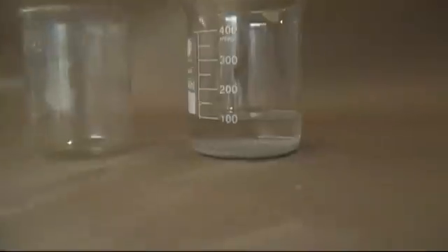Terbium sulfate is not very soluble in water, so after the 4 grams dissolved, I was left with the white powder on the bottom of my beaker. You could boil it down for max yield if you like. Either way, you can remove the liquid by decanting it off. You'll be left with a white powder that turns gray if left out.